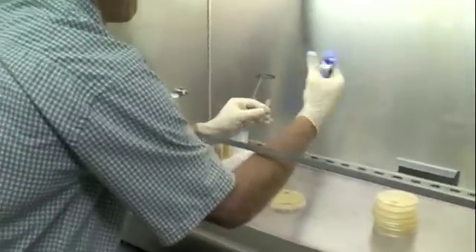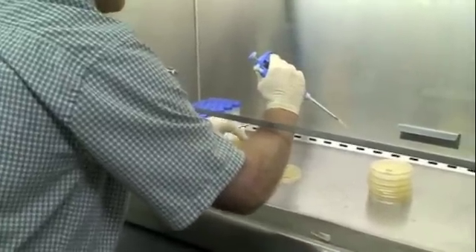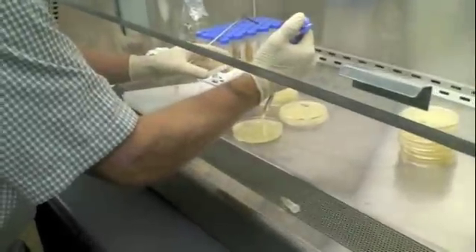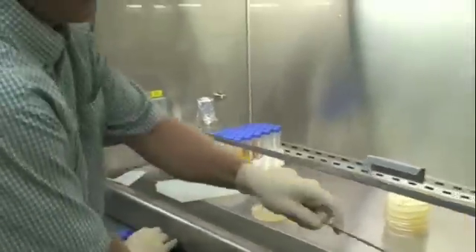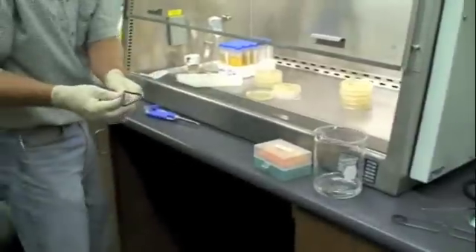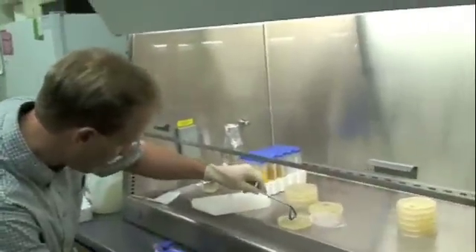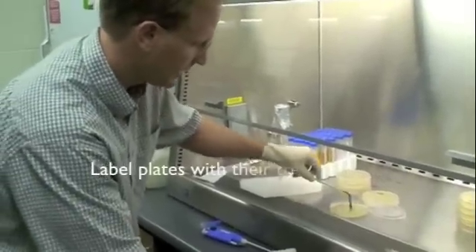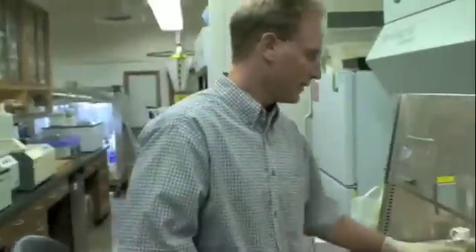Give it a little inversion. I accidentally touched this to something. I'm doing this a little bit risky in the sense that I didn't write down what is what. I should have had a pen here, and as I add things, write down what each plate is. I'm going to follow the same procedure and do it for the two other plates, then take 100 microliters of this control, put it on a plate, and we'll see what grows in the morning.